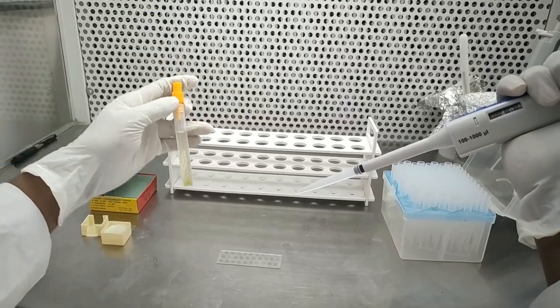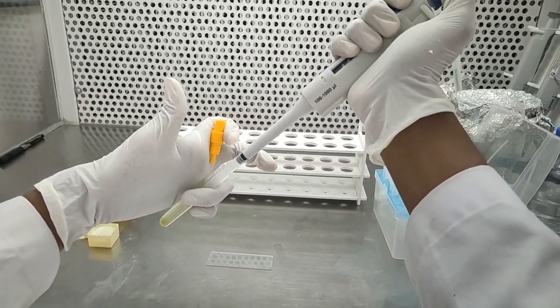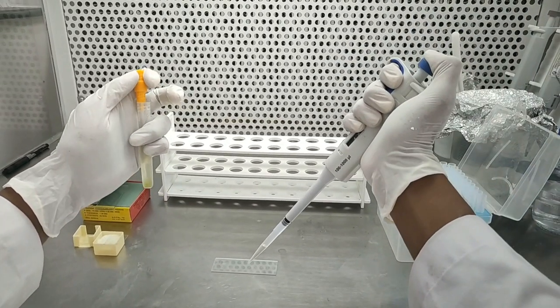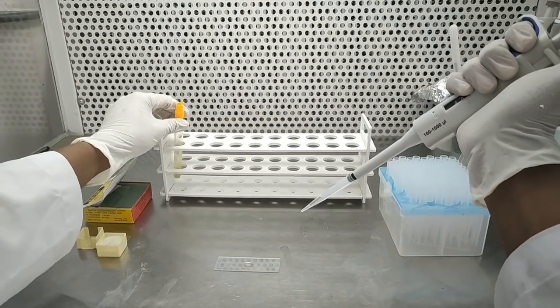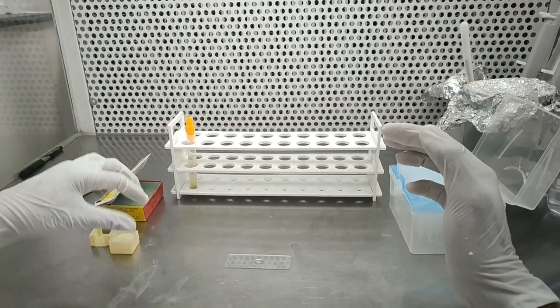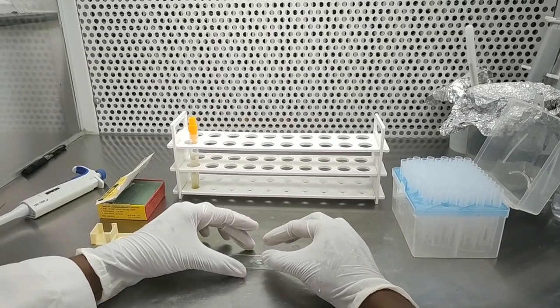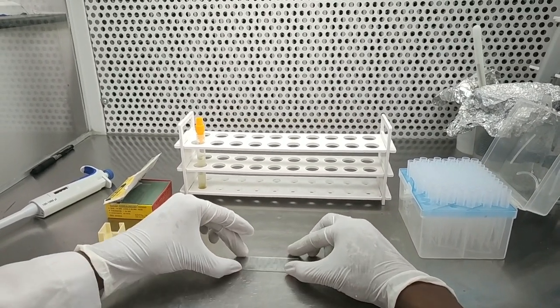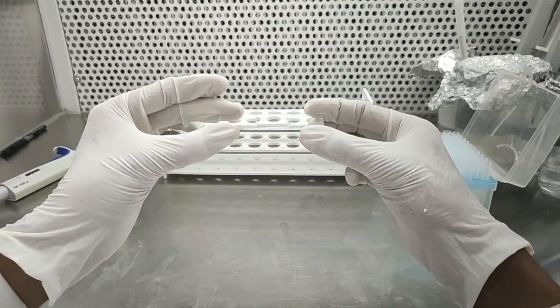We are going to take a drop of the sample and put just a small amount of water onto the slide. Now we are going to place a cover glass on top of it, and then mount this under the microscope.